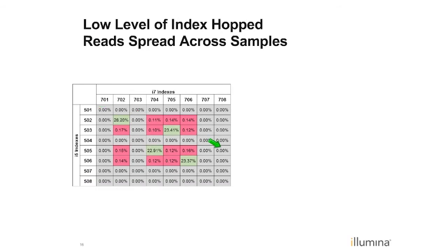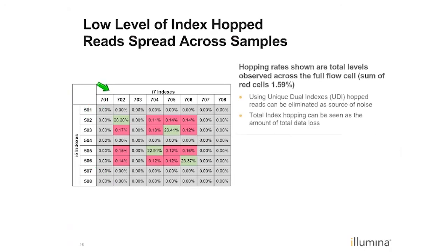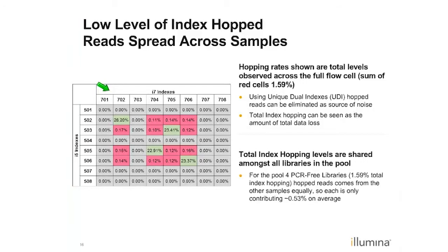So this shows the results of taking the unique combinations of adapters and using them in a 4-plex to create PCR-free libraries. What we did is we made 4 libraries using these combinations, 702, 502, 705, 503, et cetera, that are shown in these green boxes I'm pointing to. And we sequenced those, and then we demultiplexed them, and what we noticed is that using this approach, where we would not expect any of these red or pink boxes to have any library in them because we didn't use those indexes, because of this swapping or hopping phenomenon, we do get some signal showing up, and if you notice, it's basically in the row or column of each of the indexes that were used. So that's a hallmark of this recombining effect that we've been talking about.